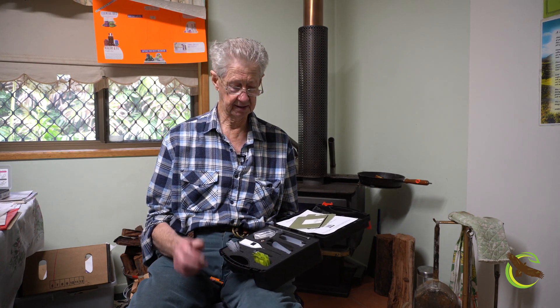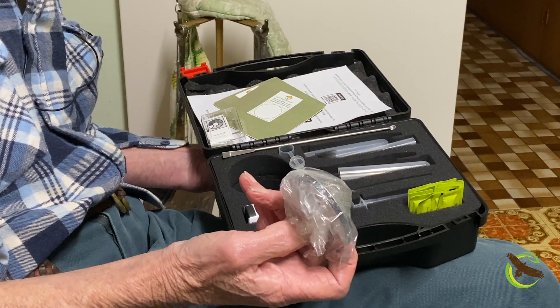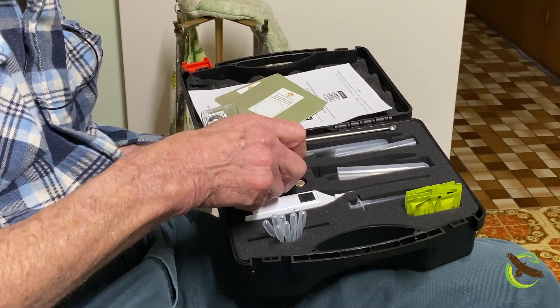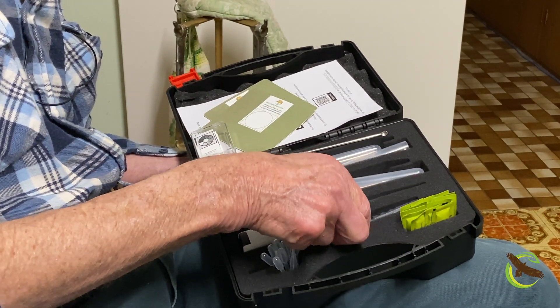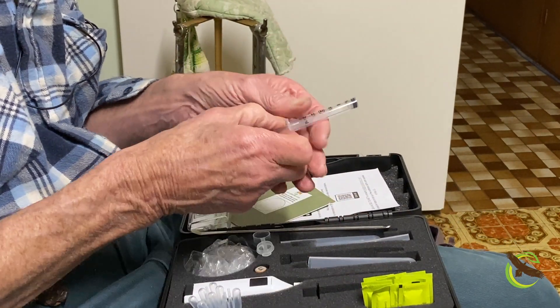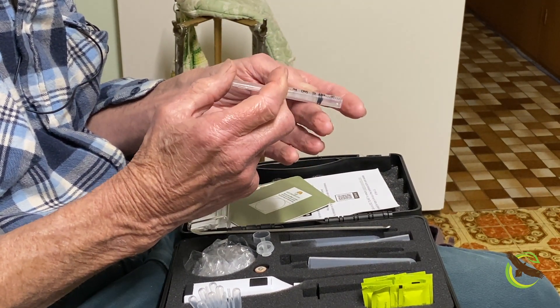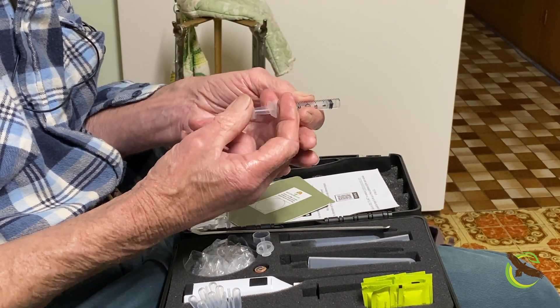As far as what's in the kit, you have a couple of little stainless steel soil sieves for sieving the soil. Then we have a little syringe that's cut off on the end. We need enough soil to give us one mil of soil in that syringe, and then we compact it until we have about half a mil.